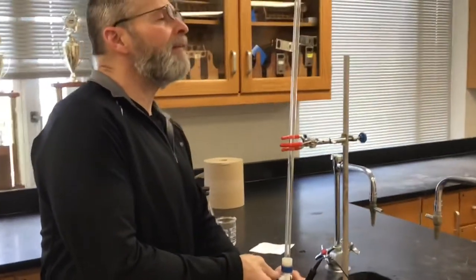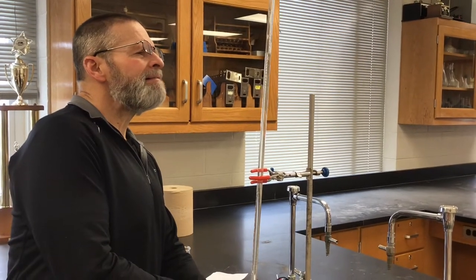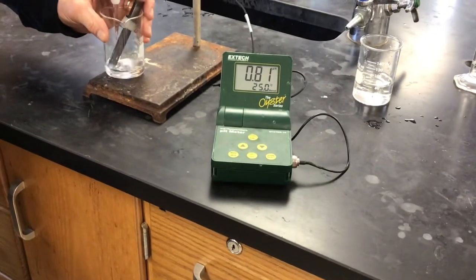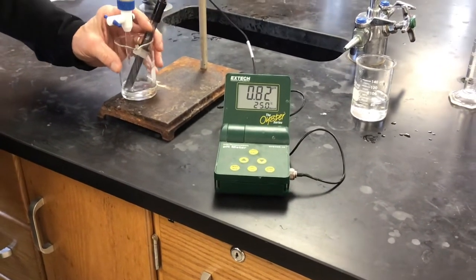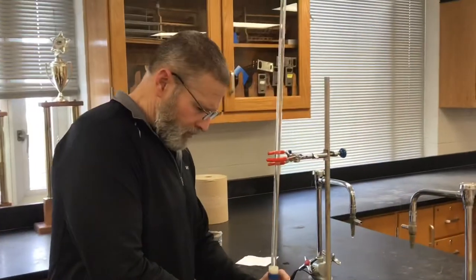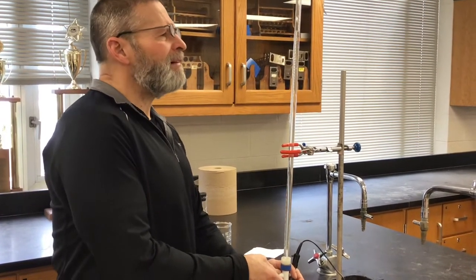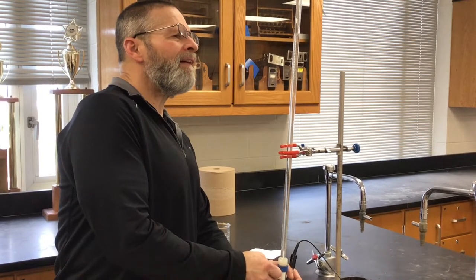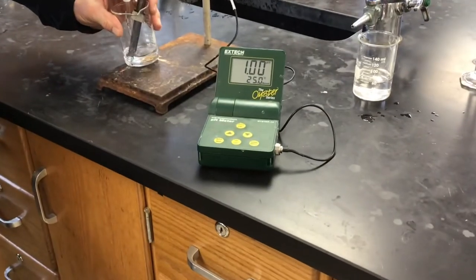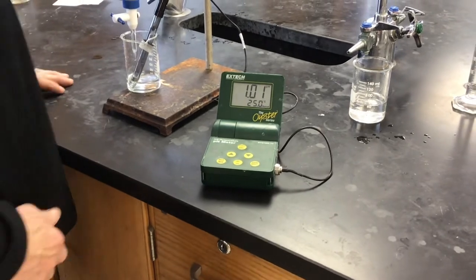That's a lot of creep in, isn't it? Six milliliters added — is that a little bigger jump? It was a little bit bigger. I'm going to try a half here. There's a half now, so that's 6.5 milliliters added.